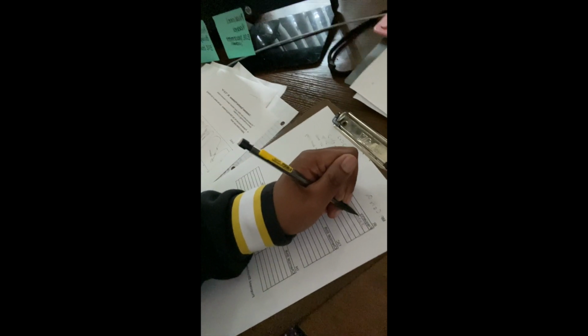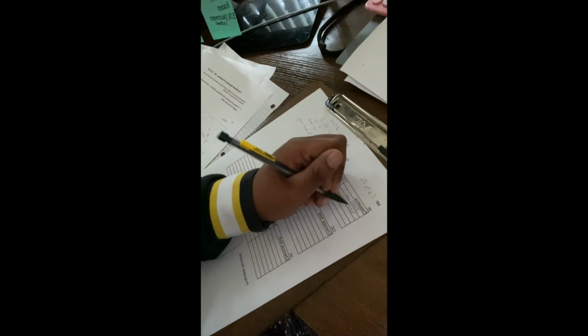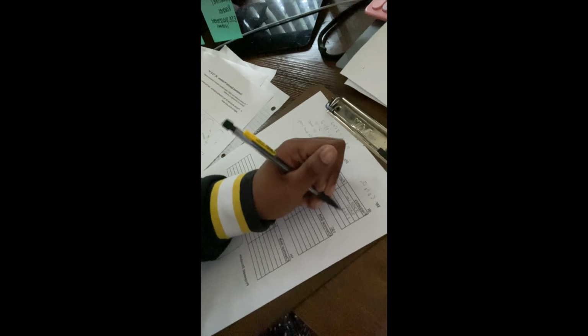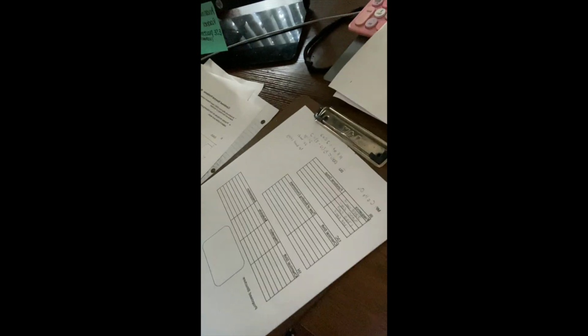I then go fill that out in this table: 3,300, 3,000, 1,700, 1,300 cm⁻¹. That's the frequency that we see certain things at. This is my favorite one, the IR graph, to interpret because it's pretty straightforward. I feel like once you look at it and get used to it, it's easy to recognize the functional groups and the bonds and everything like that to help you propose a structure.